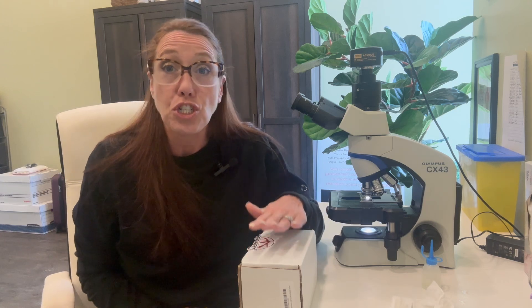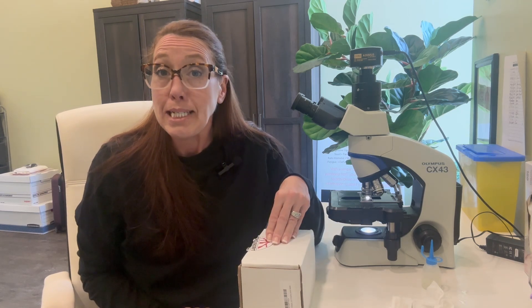I've ordered this kit from Amazon and it's a kit I've used before, so I feel really confident with it. One of our staff, Emily, who I'm going to introduce you to in a short time, she's going to be making these agar kits. There's a special way of doing it — we need to follow the instructions and we need distilled water. It can't be done without distilled water.